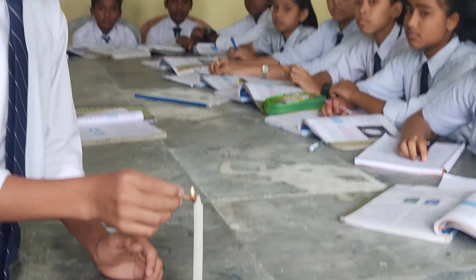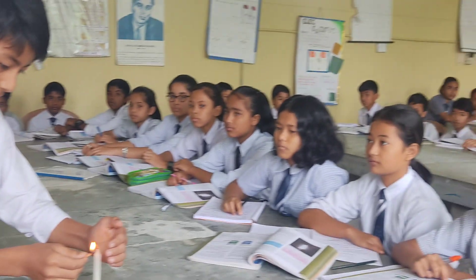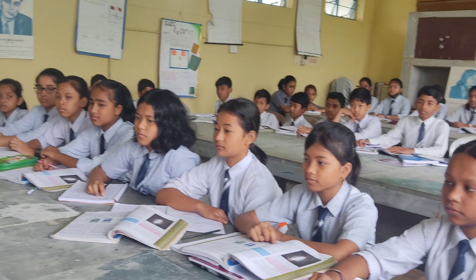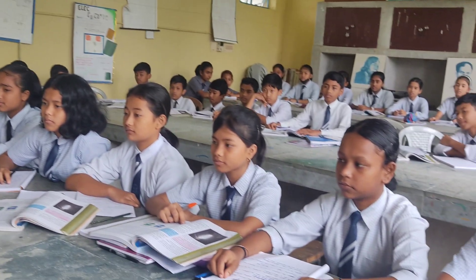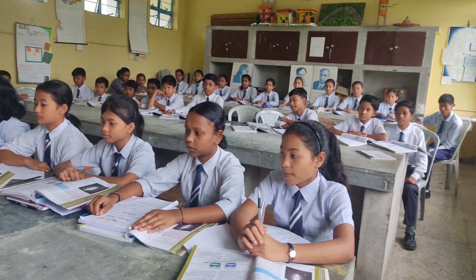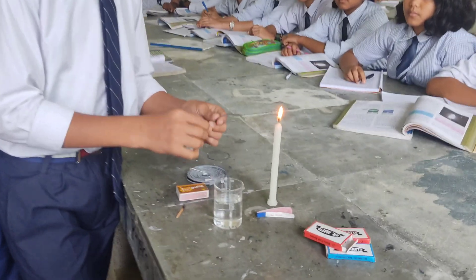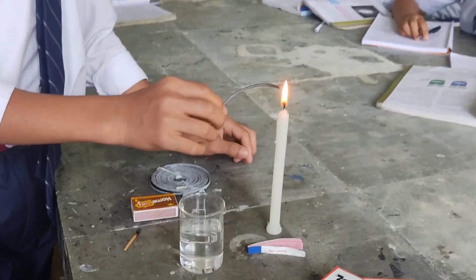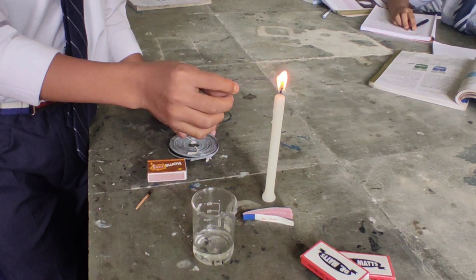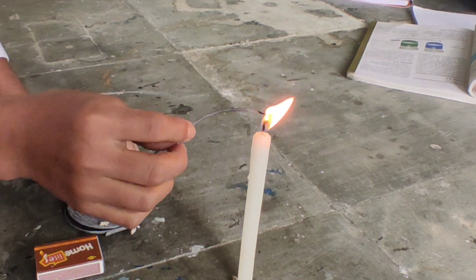Hello everyone. To study chemical change in the junior science lab of JNV Sivsagar, Assam, Sunandan of class 7 has taken a piece of magnesium ribbon and is burning it in air.